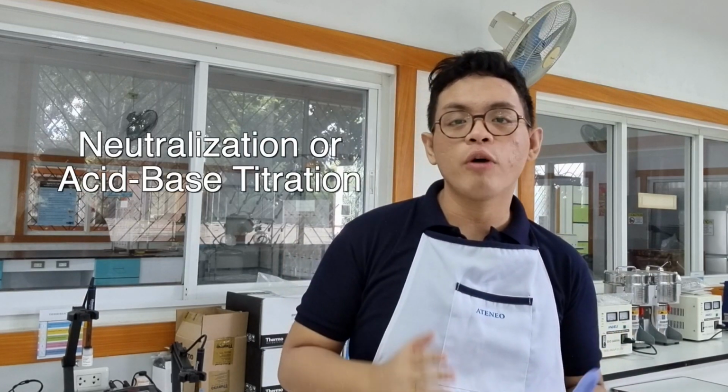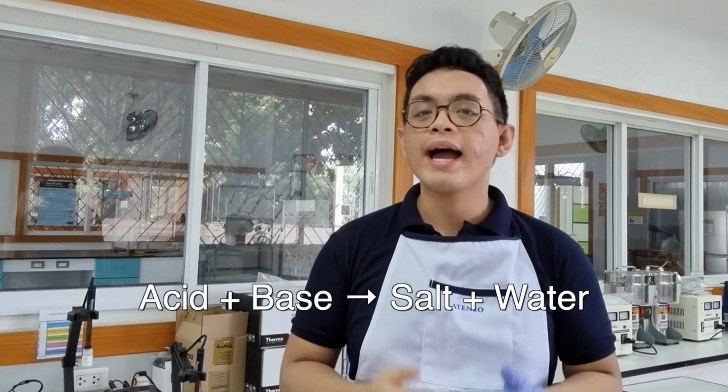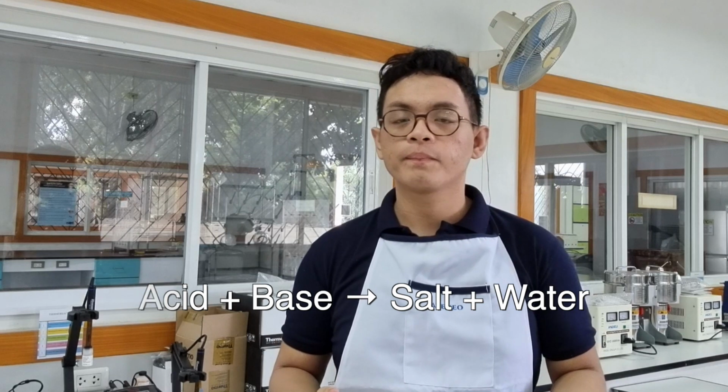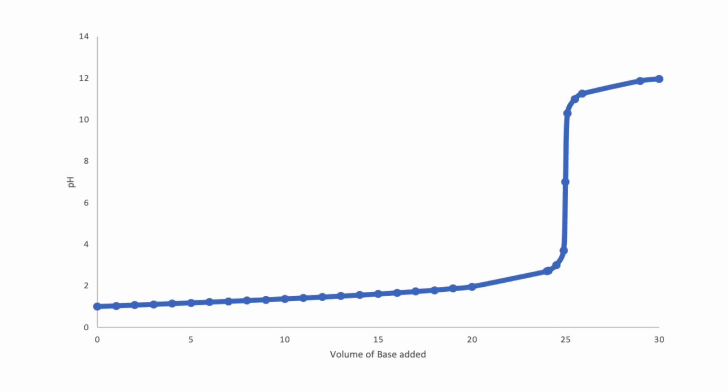The type of titration that I will be doing today is called a neutralization or an acid-base titration. A neutralization reaction, as a review, is between an acid and a base, where the reactants will form a salt and water. If I start with a solution containing an acid, the pH will be below 7. However, if to this solution I keep adding base, the acid and the base will react. Since acid is used up in the reaction, the more base you add, the higher the pH will be. There will also come a point where there will be more base than acid. In that case, the pH will be above 7.